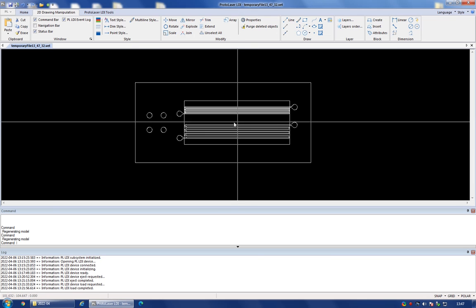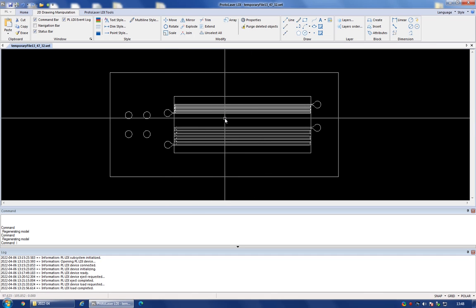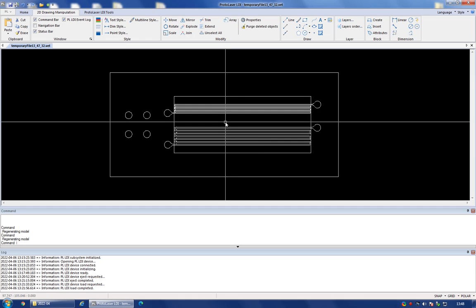And the point here is that the software doesn't do any unit conversion. So essentially, one unit in your own CAD software will be converted into one unit in this software. And this software uses micrometers as the base unit.